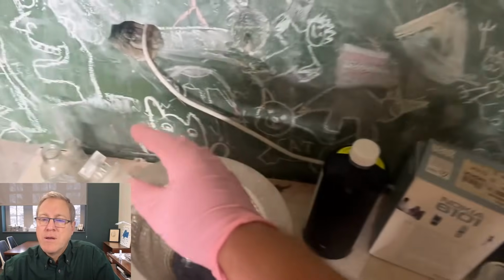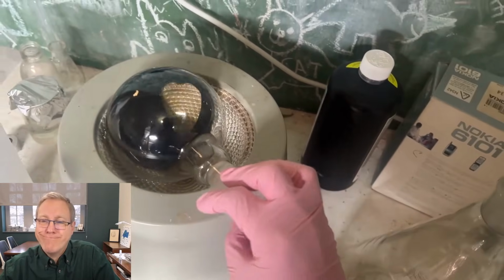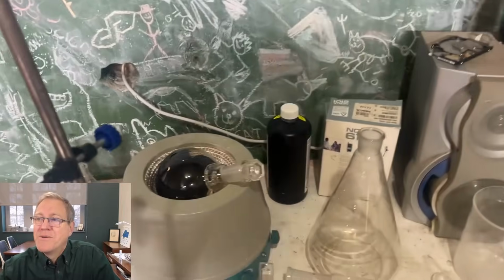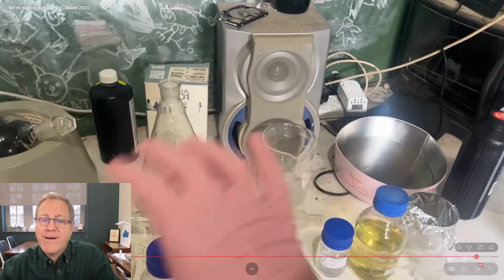And here's this tar left over from the vacuum distillation. Whoa. That is high quality tar. I'm nearly lost for words at that tar. That's amazing. So yeah, we've definitely lost some yields in there, and maybe our vacuum distillation wasn't so great really either. You could tell there was definitely some bits of product.